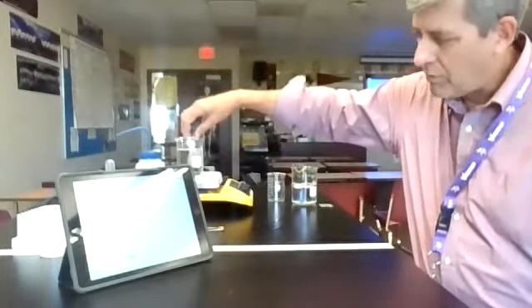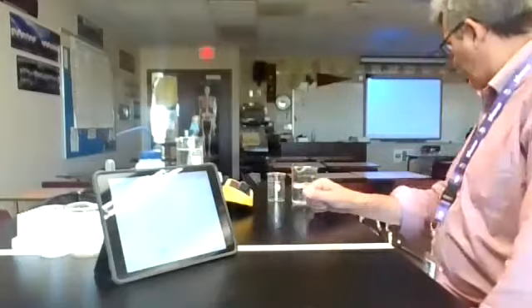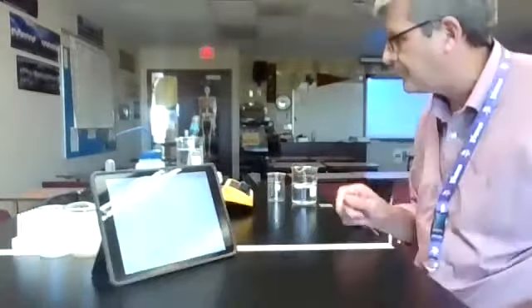And I think we're getting pretty darn close to being done. The temperature has started to rise again. We had a nice little plateau and now the temperature's going up. I'm going to let it go for another minute or two. We've only been going for about 5 minutes or so, so I'm going to give it another couple minutes to let this finish.